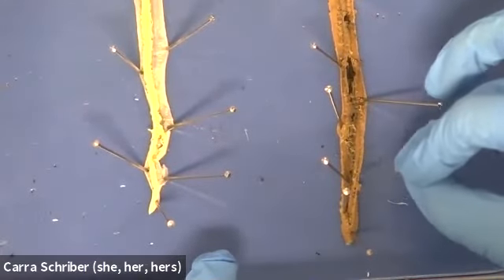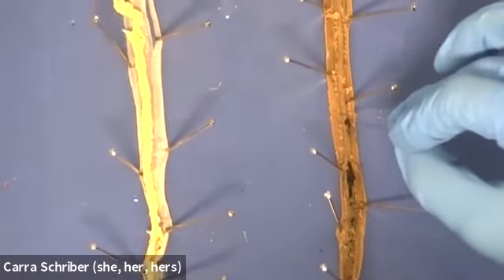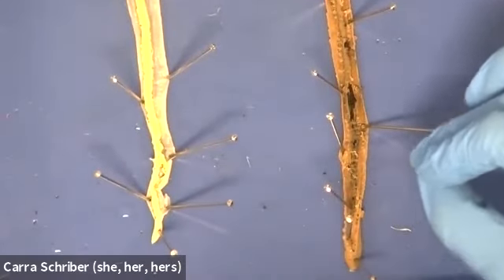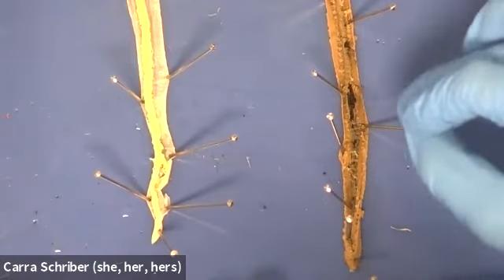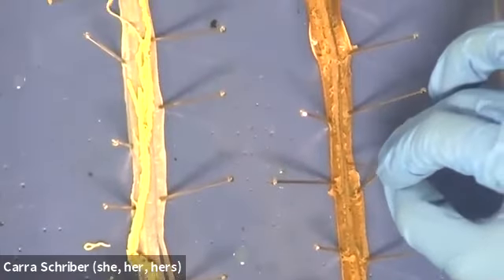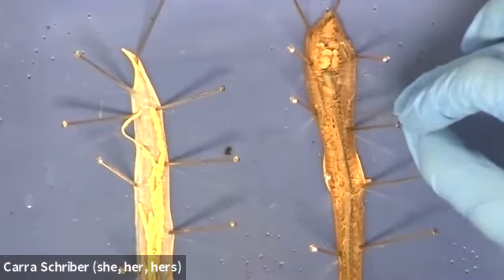And here you can see there were little cuts that happened along here and here. And then for the rest of the way, it didn't get cut. And really that's just because at the very, very tip of the earthworm, it got very, very thin and incredibly difficult for me to cut away the connective tissue there. So that's why those cuts are there. But let's follow it up. Intestine, intestine, intestine, intestine, intestine. And let's do it backwards just for fun.